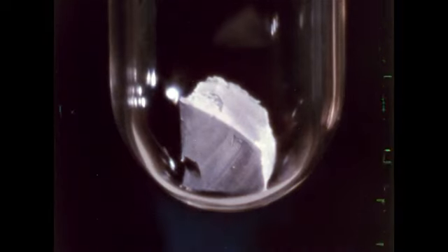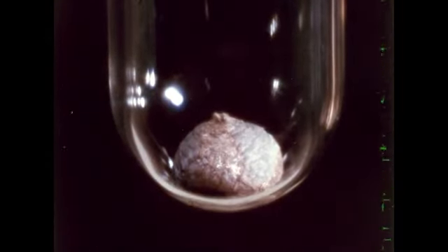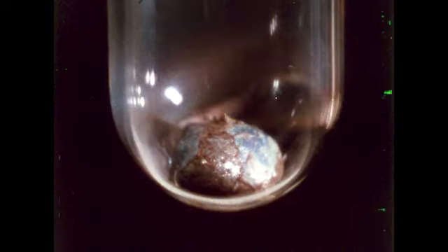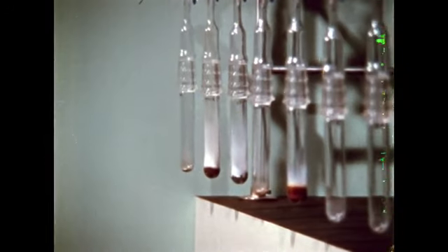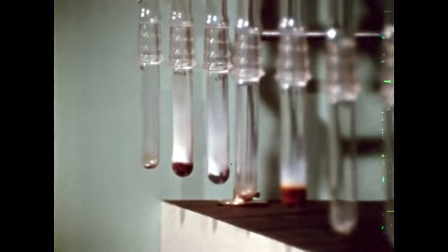Oxygen is our next gas. It didn't take much heating to start that reaction. Oxygen is certainly reactive. And now the last one, xenon. Xenon is inert with potassium. Comparing all of the tubes, we find 4 of the gases gave white products with potassium. Apparently the other 6 gases are inert toward molten potassium.